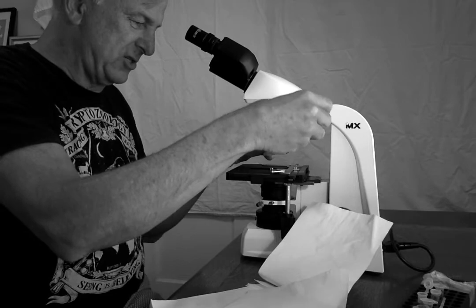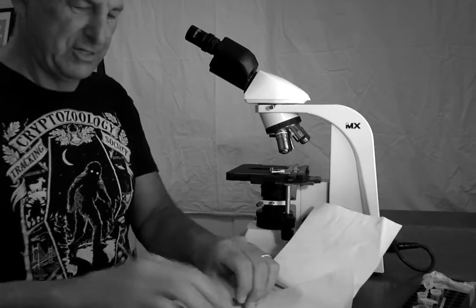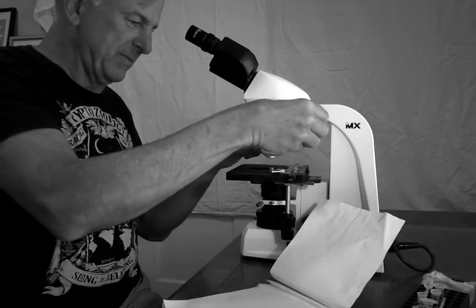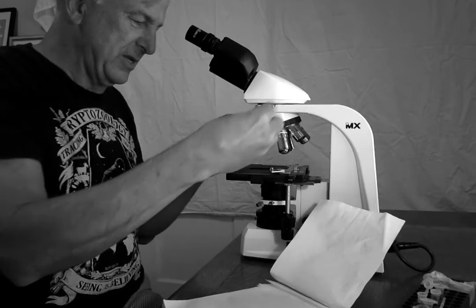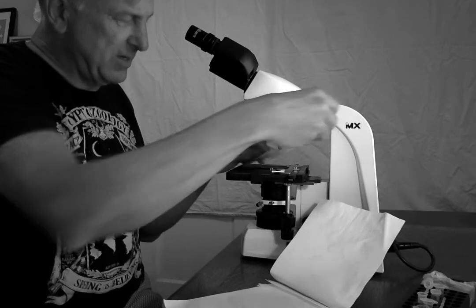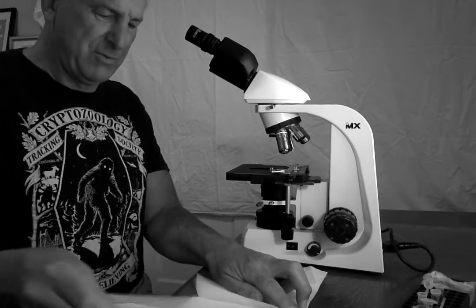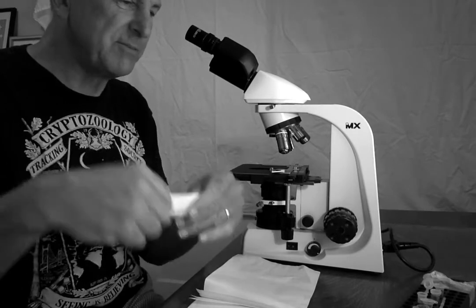And I see a sheen on my lens paper. Toss that one in the trash. I'm going to get another piece of lens paper. I'm going to wipe some more. I'm not really seeing a sheen now. I think we're getting most of the oil. I'm going to take one more piece of lens paper. Again, folding it up into a strip.